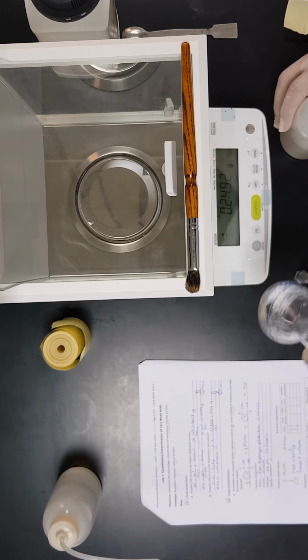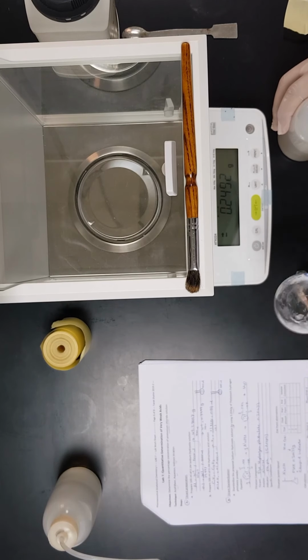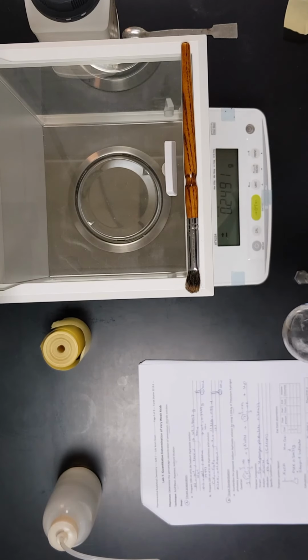Of course, we may use heating, but this would change the volume of the water, so the measure of the content of the volumetric flask would not be that accurate. So we will go slowly till we dissolve the entire quantity of the sodium hydroxide.